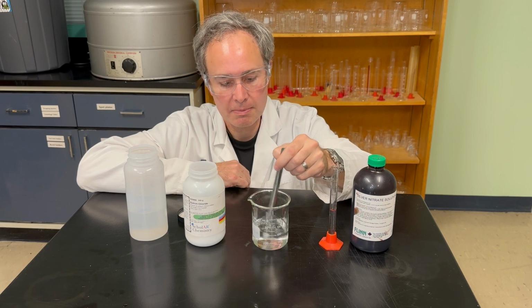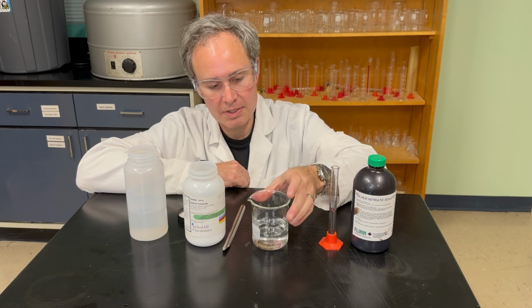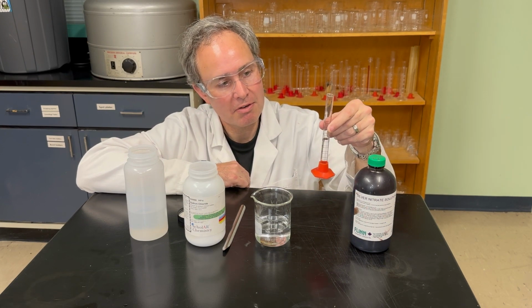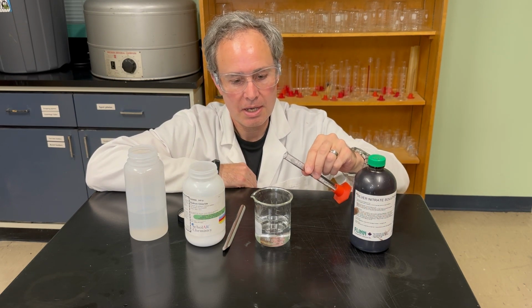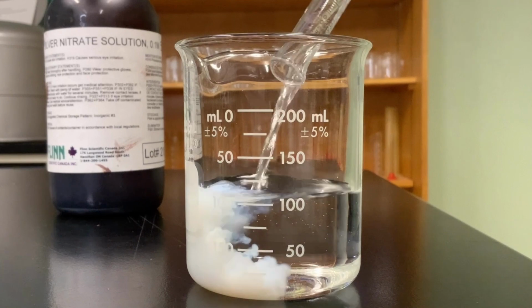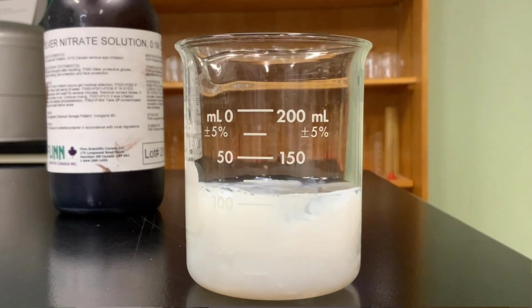So we're almost there. And so if you take a look at that, that looks quite clear. And I've already prepared the silver nitrate by pouring in about 5 milliliters into this graduated cylinder. So 2 clear liquids, and watch what happens when we react the two together. Here it is again in slow motion. So I want you to notice how this precipitate forms, and it looks a lot like smoke filling up a room, and that's due to the very tiny particles of solid that are formed as the two liquids meet.